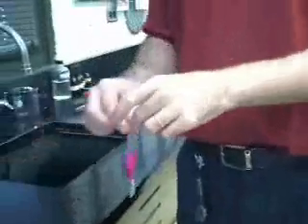Now, we've got another very similar experiment with dialysis. And now I've got a starch solution inside my beaker. So I bet you can guess what I'm going to put inside my bag. It's going to be iodine.